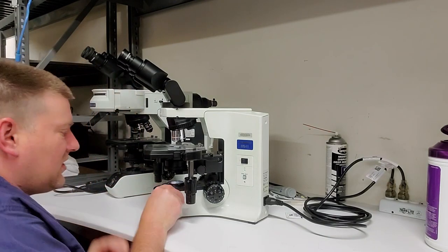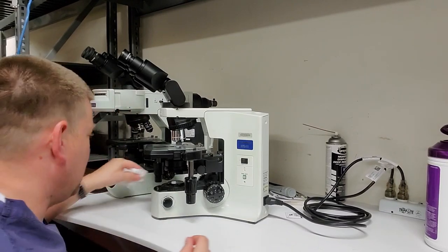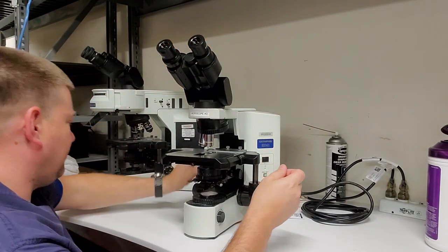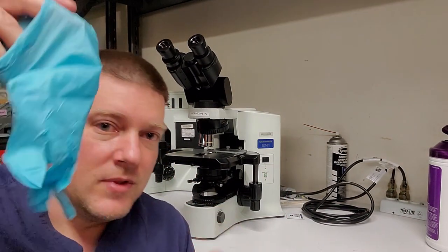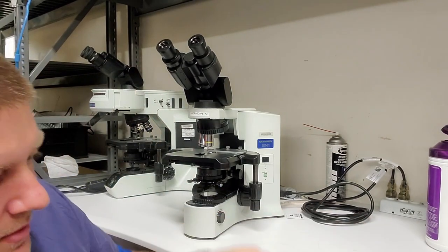Oh, see, there's grease right there. And that was on the dimmer knob. I'll almost definitely be touching the dimmer knob. So make sure that all of these areas right here are nice and clean. Okay, so now that the area is clean, you're going to put on your gloves. A nice brand new set of gloves.